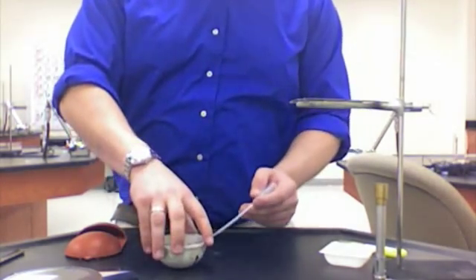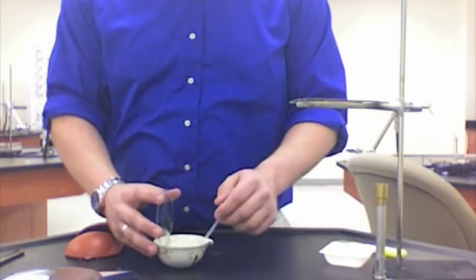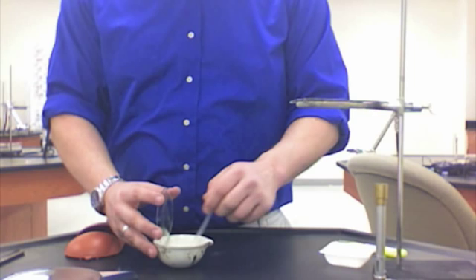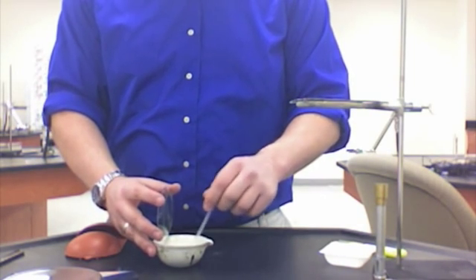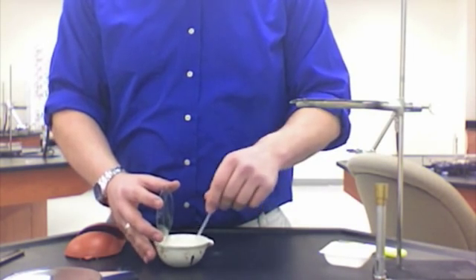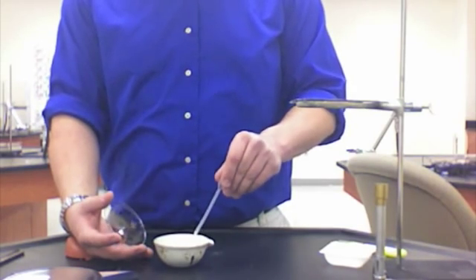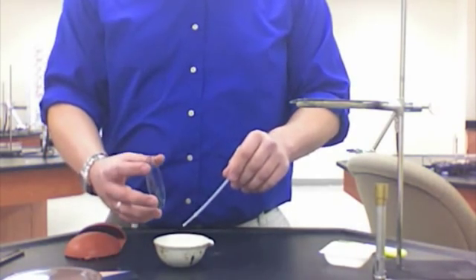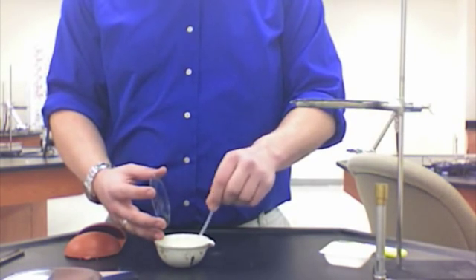Now that we've added all of our acetic acid to the sodium bicarbonate, we're going to stir it a little bit and make sure that we don't see any more bubbles. If there's no more carbon dioxide being produced, that means the chemical reaction has been completely reacted and there's nothing left to react.